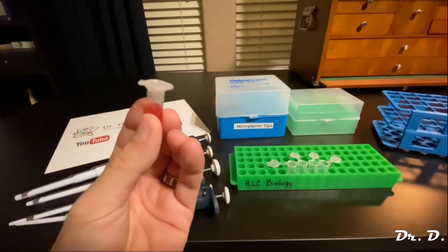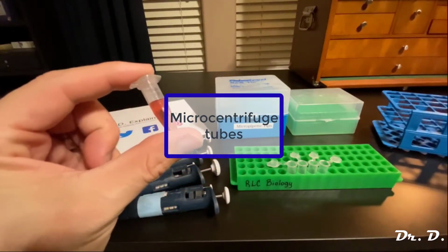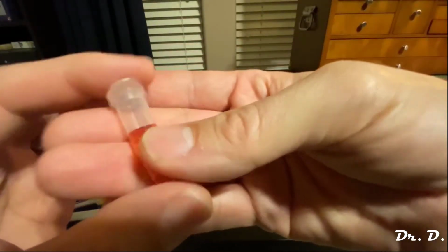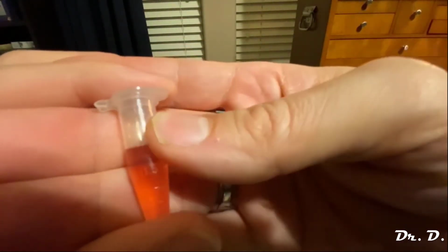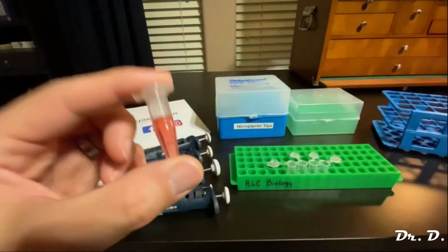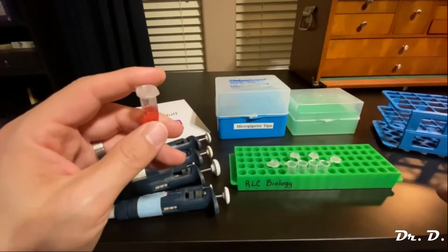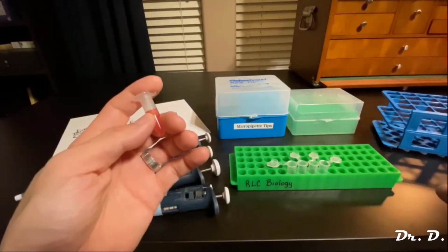These are called not test tubes, but microcentrifuge tubes. And if you look here, you might be able to see it on the side. Yeah, there we go. You can put up to 1.5 milliliters of solution into this tube. So this is a perfect tube for dealing with tiny volumes of solution.